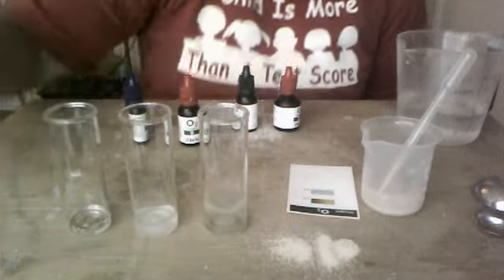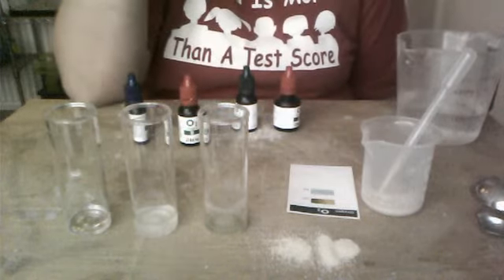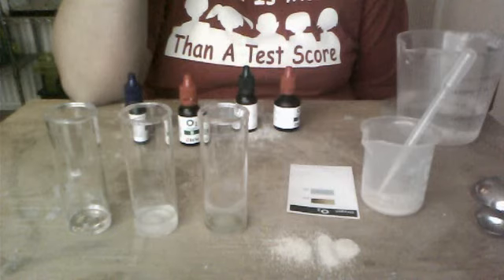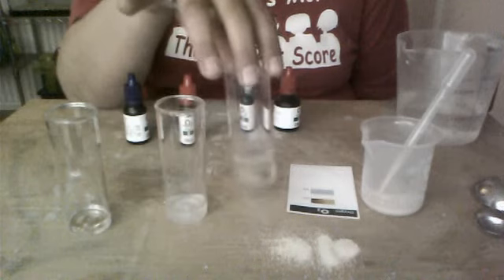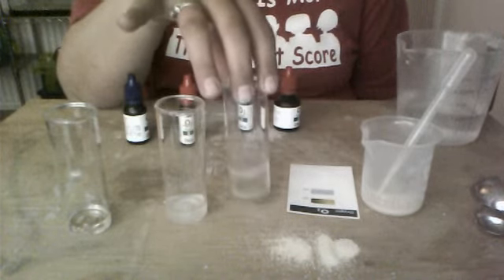Okay, so this is part 2 of my video because I'm only allowed a certain amount of time on YouTube. Anyway, where we left off was we were doing phase 3 of the lab and I messed up and I had to restart it.